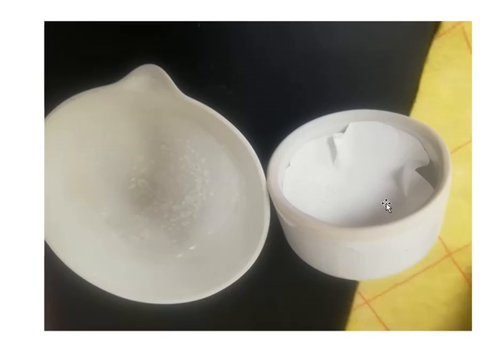So what I have to do is take the weight of this container with the filter paper, for example, to find out the suspended solids, and I will subtract the weight of this dish. So I will get how much suspended solids there are. To get the dissolved solids, I again weigh this evaporating dish with the solids, and then subtract the weight of this dish from the total material.